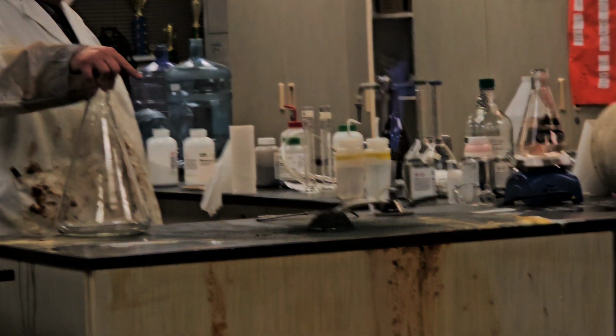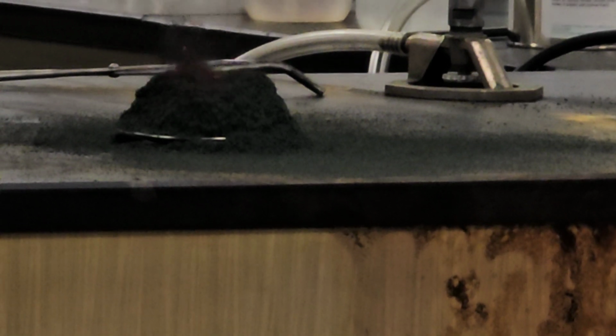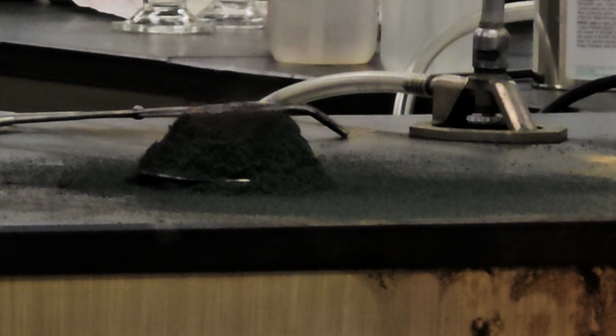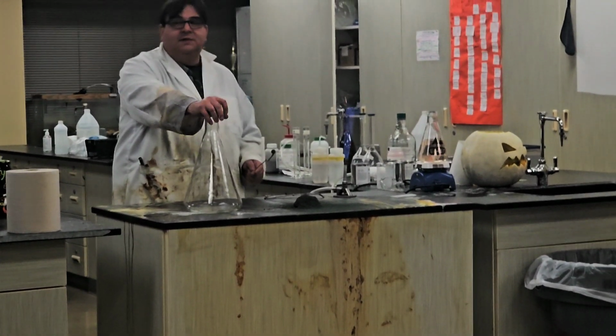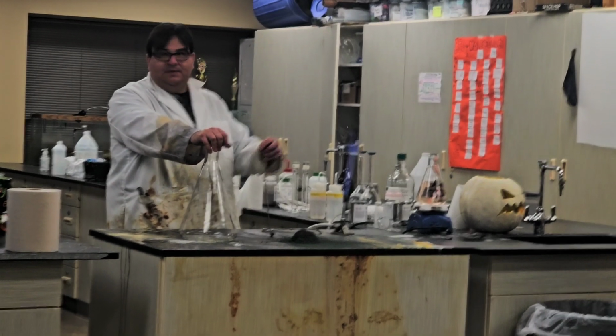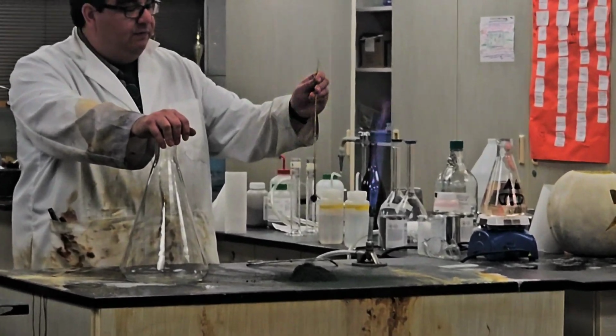Okay, so what was the color originally? Orange. Like a bright orange, okay? So now it's like tripled in size and it's green. So it's like making a little volcano, okay? So I'm going to take some of this volcano and we are going to make some fairies, but this is going to be Peter Pan rules for fairies, so you got to believe in them for them to stay alive, okay? So you got to believe in the fairies.